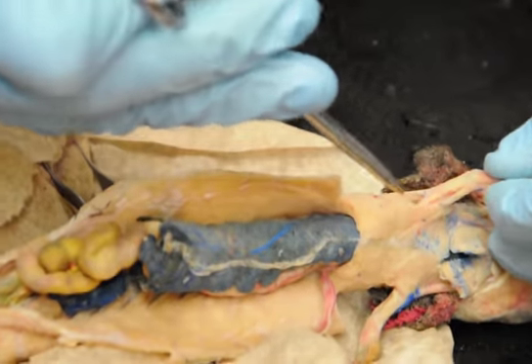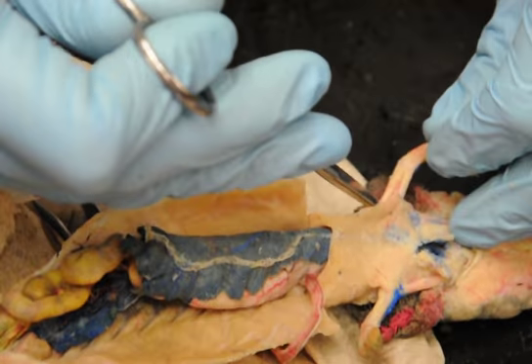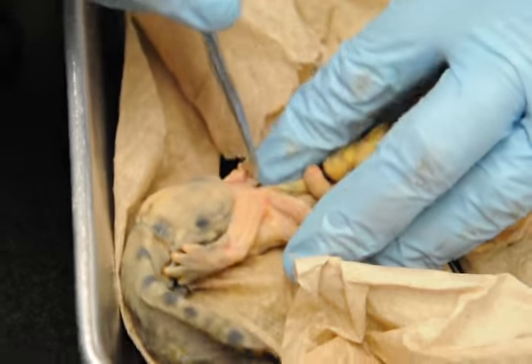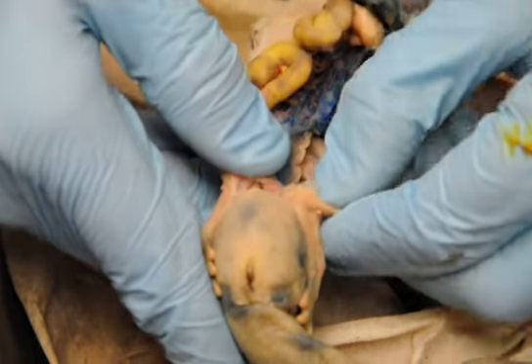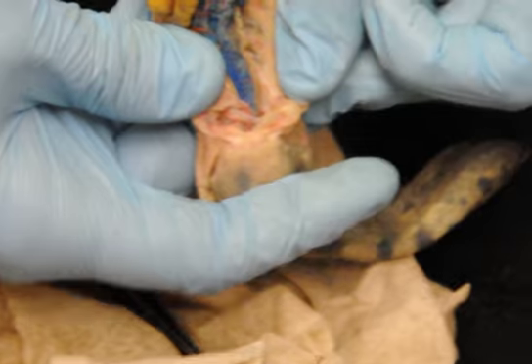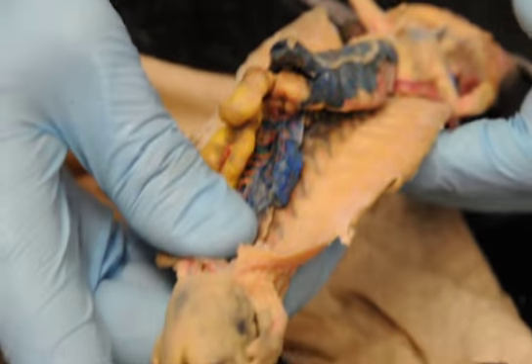So those are the only two we need to know in the upper body? For the arms, yeah. What about the lower leg? Is there anything in the lower leg that we need? Iliac, if this were open far enough. Oh, that's right. It's on the inside. Yeah, I mean, it's going right to the leg, so it's the only thing that's crossing across at the bottom. Okay. Cool. So, yeah, way in there, the one that's kind of the red artery going to the leg, that's the iliac. Don't worry about the femoral.